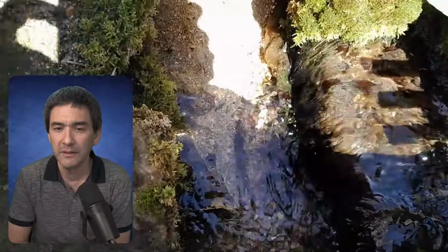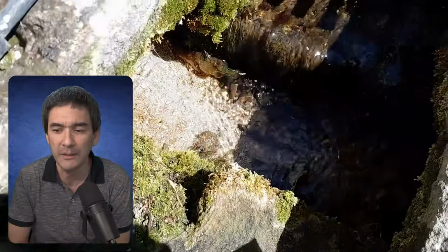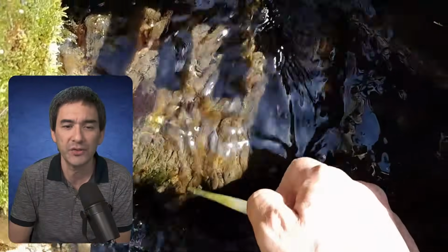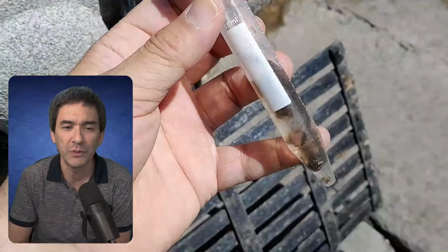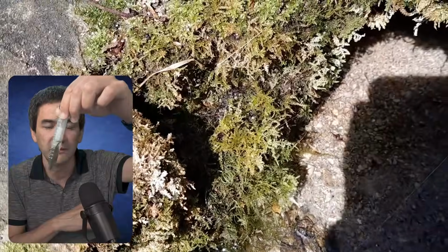So look at this here. Lots of moss on the side, lots of filamentous algae. And I'm already reading some of the comments here. And that's what I did, I simply tried to get some of those filamentous algae off with a tweezer, which wasn't so easy, but after a minute or so I collected a whole tube, and basically here it is.